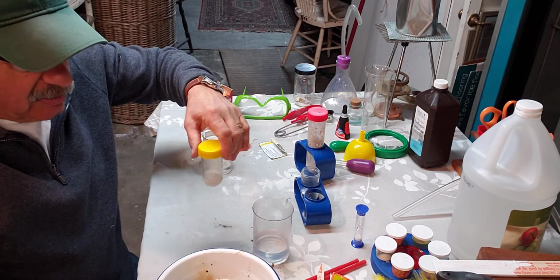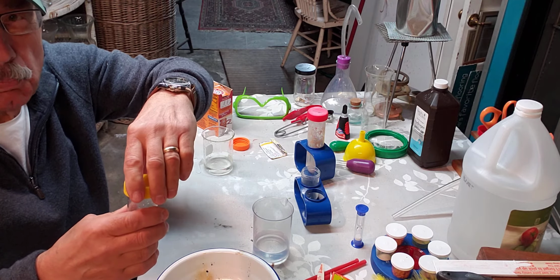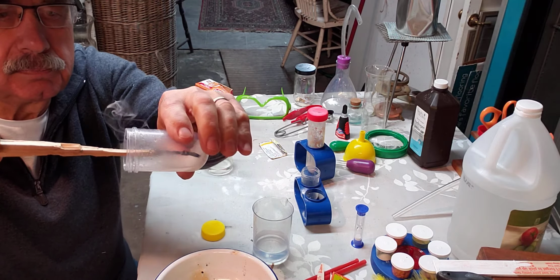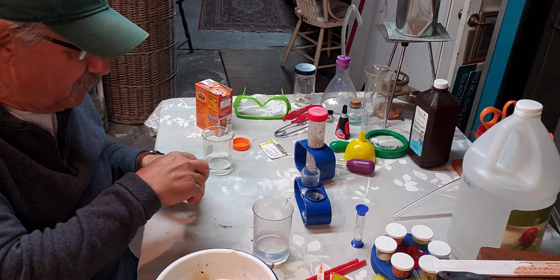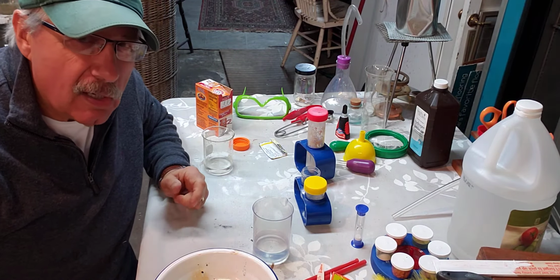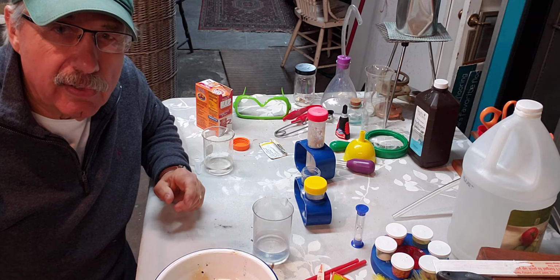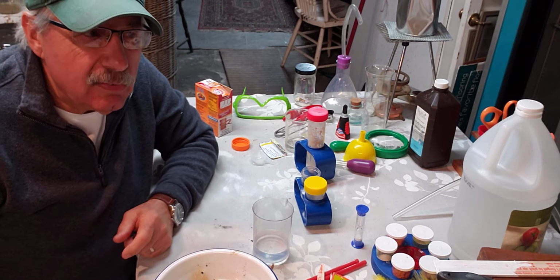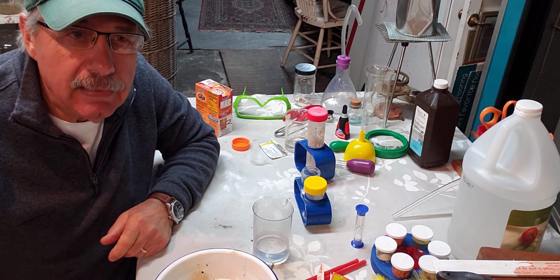So what I'm going to do next is I'm going to open up this one with the carbon dioxide, and I'm going to put the wood splint with the flame in there, and it's going to immediately go out. Watch. See that? Fire's gone. Okay. So we proved that one of the properties of carbon dioxide is it puts out a flame. And we also saw with the oxygen that when we put the glowing wood splint in there, it burst into flames because oxygen is very combustible, very flammable. Okay. All right. I guess that's it for today. Carbon dioxide and oxygen and their properties. Oxygen burns and carbon dioxide puts out a burn.